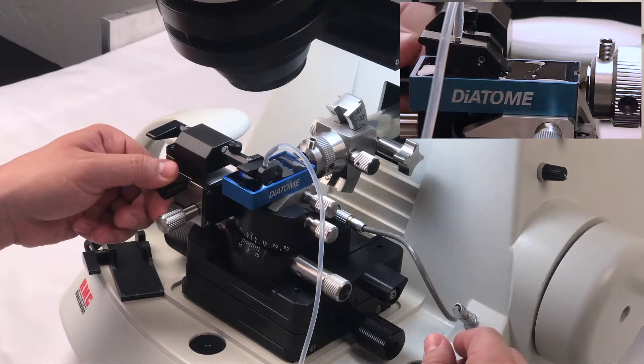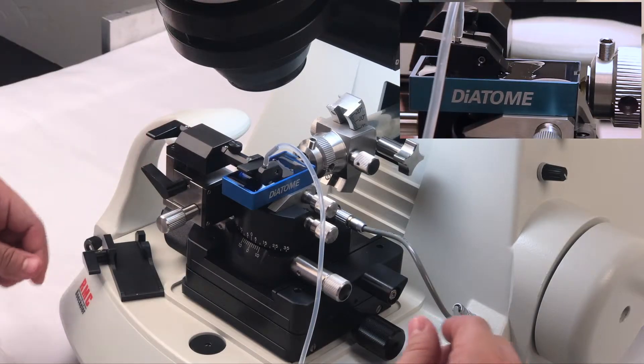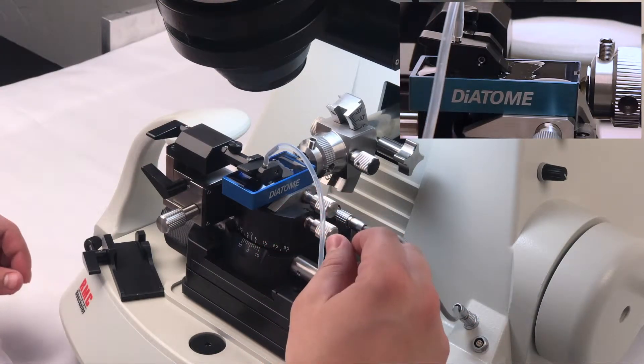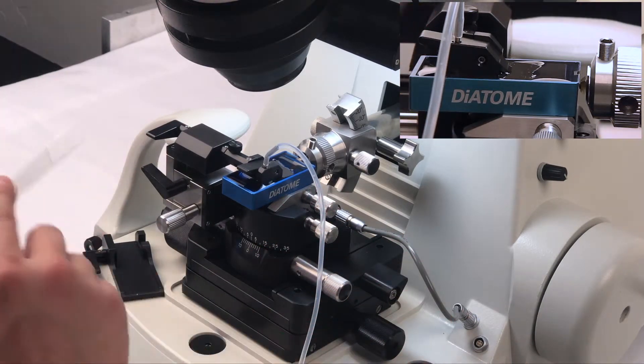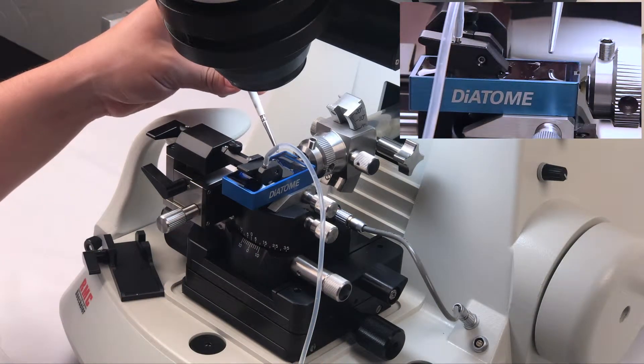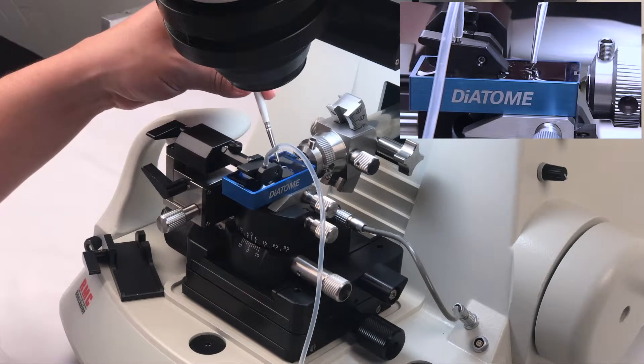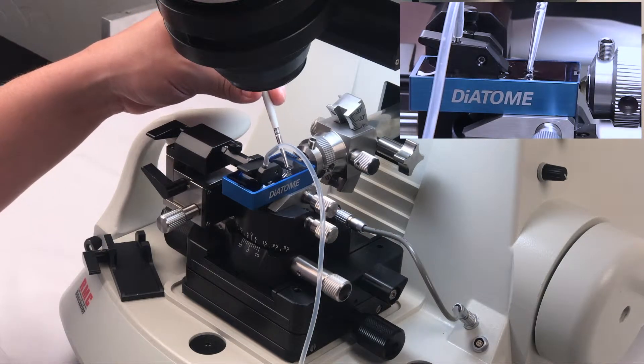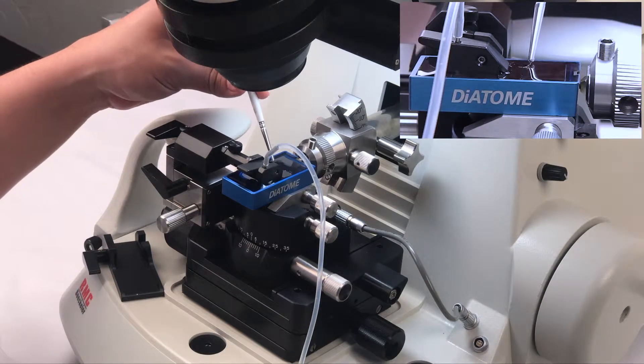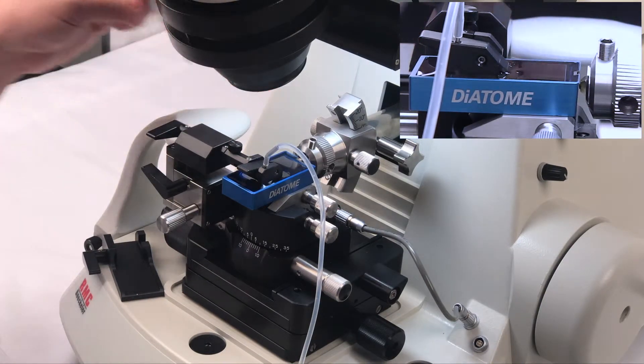So once you're comfortable, you can also use your eyelash tool to maneuver the beach on the substrate by touching it, like so.